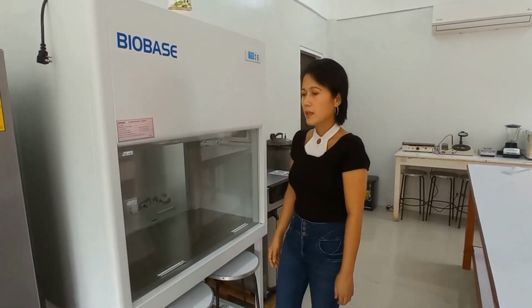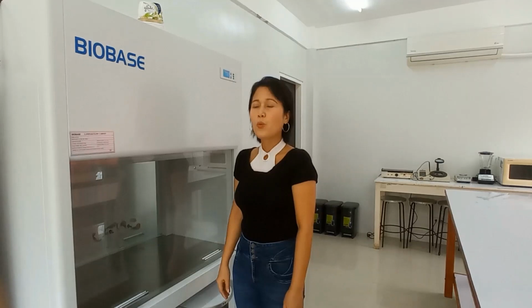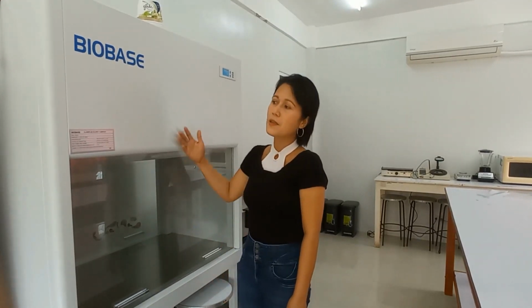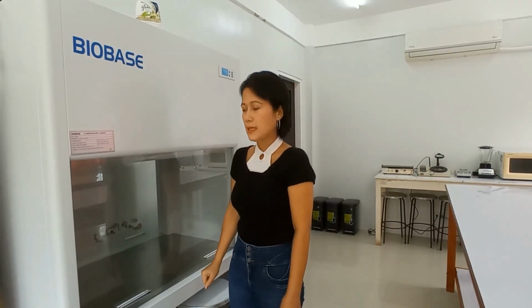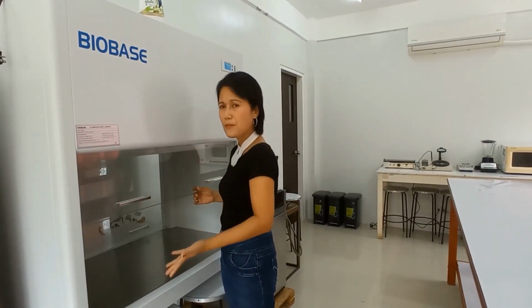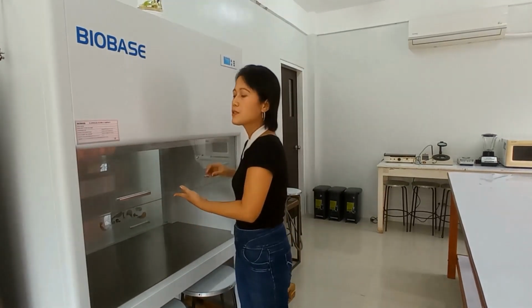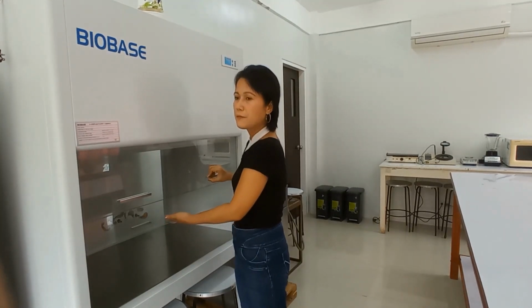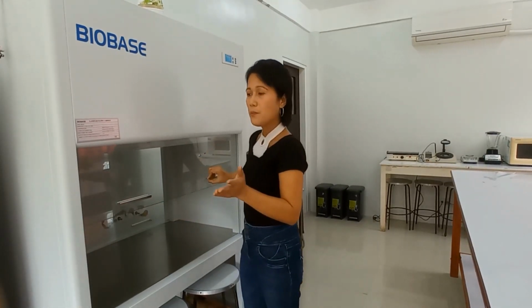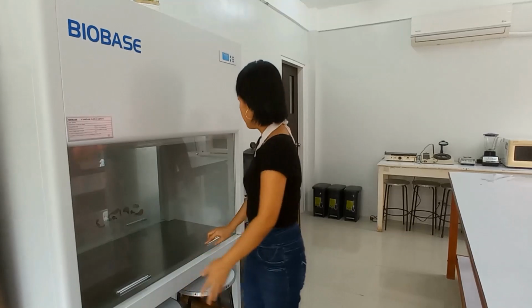One of the topics that I usually emphasize with my students is the application of aseptic method. When I say aseptic method, it means avoiding every possible contamination. And one of the ways to achieve it is the use of a laminar flow cabinet. This laminar flow cabinet will minimize, remove as much as possible contamination. So this is where you process your samples so that your sample is free from possible contamination, and also you, the researchers, can be protected.